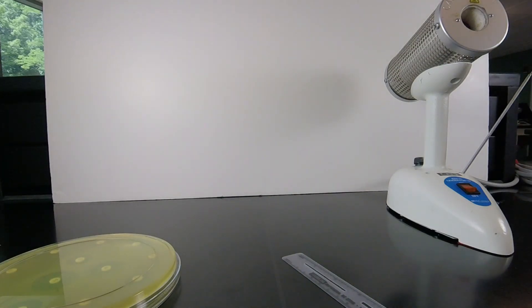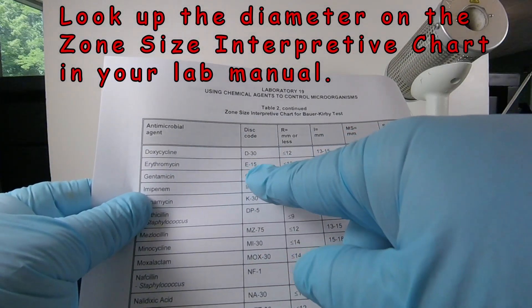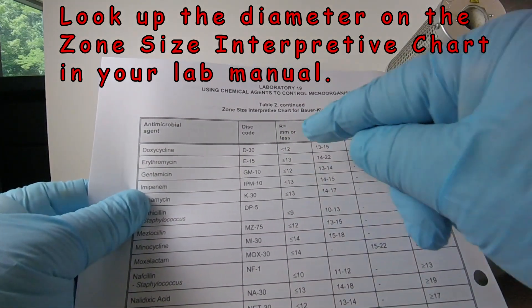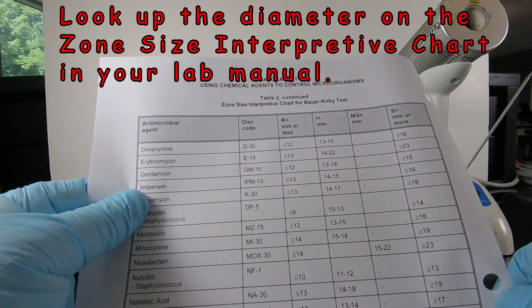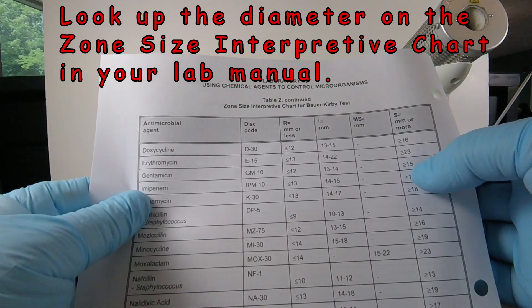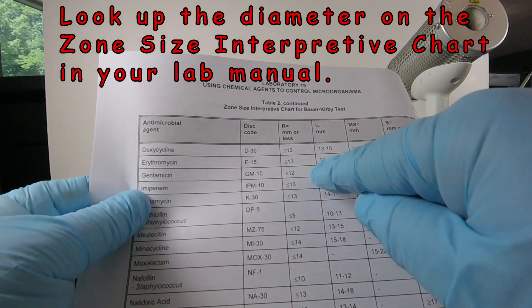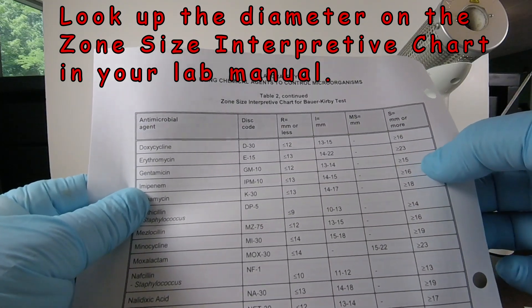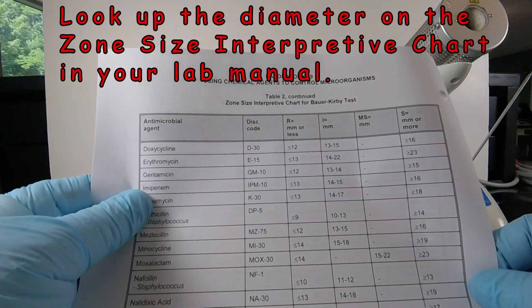Then we go to our interpretation table and find gentamicin. For gentamicin, if the zone of inhibition is 12 millimeters or less in diameter, the bacterium is resistant — R stands for resistant, meaning the antibiotic is normally not effective. If we look on the right-hand side under S for susceptible, a zone of 15 millimeters or more means the bacterium is susceptible. In between, 13 to 14 millimeters, is an intermediate area where the antibiotic may or may not work. Since this one measured 19 millimeters — 15 or more — this Pseudomonas is susceptible to gentamicin.